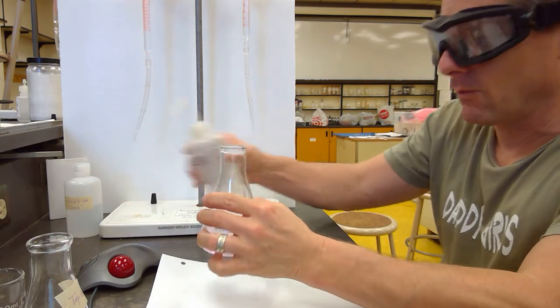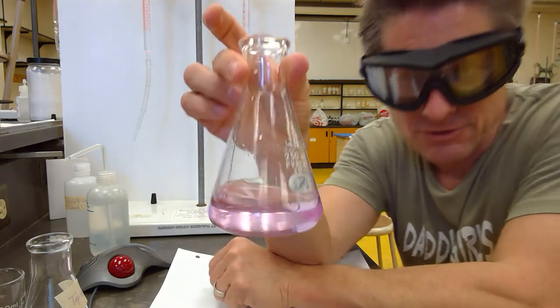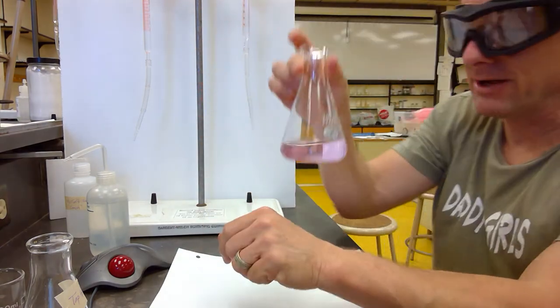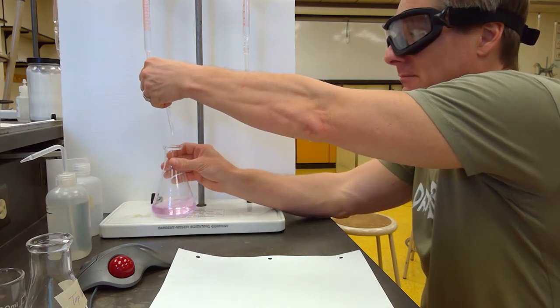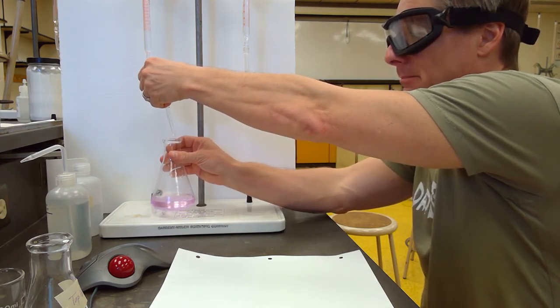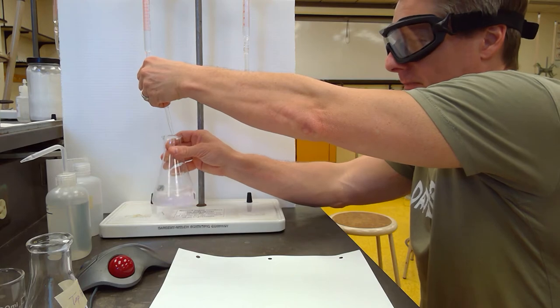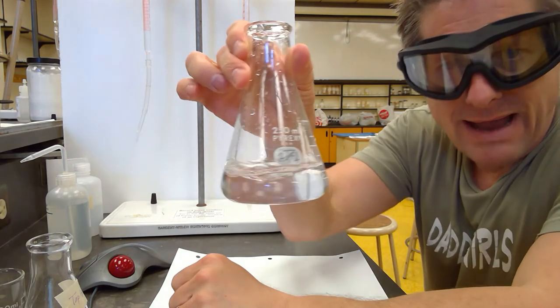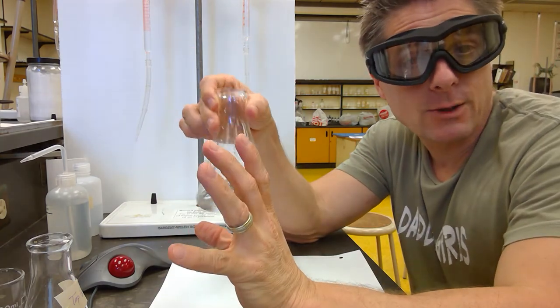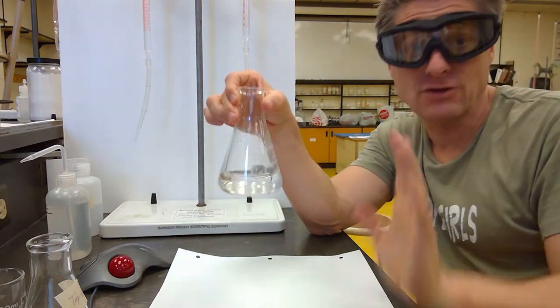Spray that down. So would you agree? I'm pretty close. That's the color change from one drop. It's pretty crazy. All right, let's head over here. Let's add one drop of our back titrate. And tap that off. So back to colorless. We are very, very close. We're less than a drop away. We've done two back titrations.